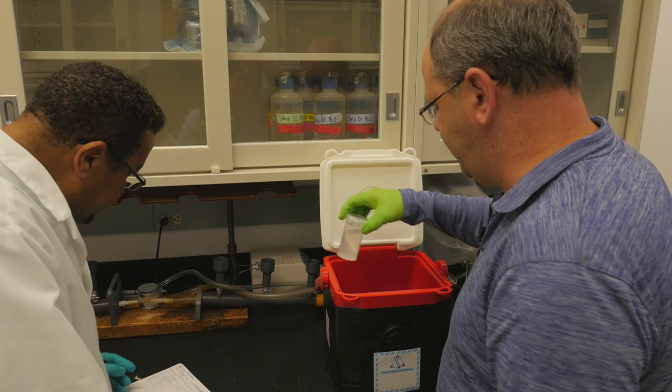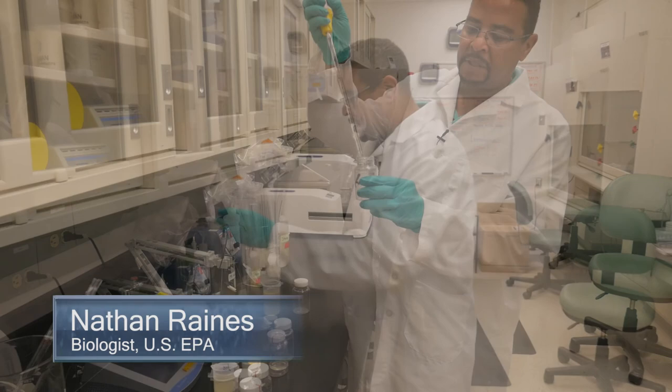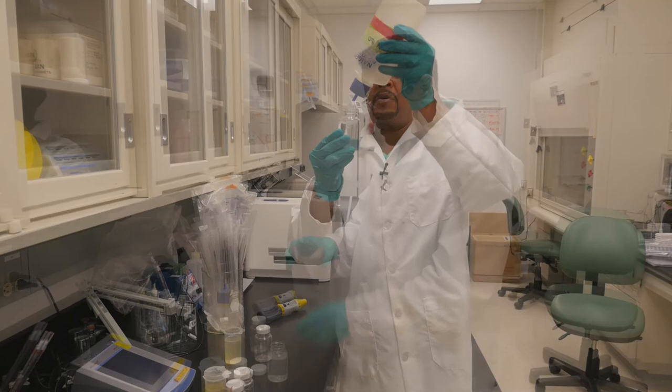After samples are collected, they are put on a chain of custody and brought to the lab for analysis. To begin, the scientist makes a dilution. So I'm going to take 10 mils of this sample and I'm going to bring it up to 100.